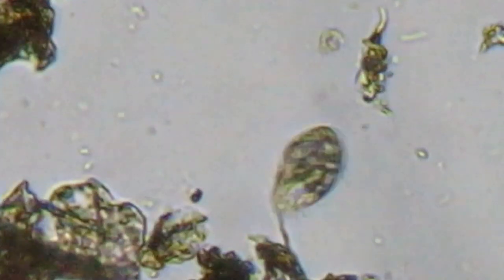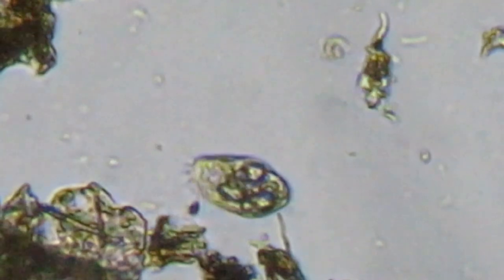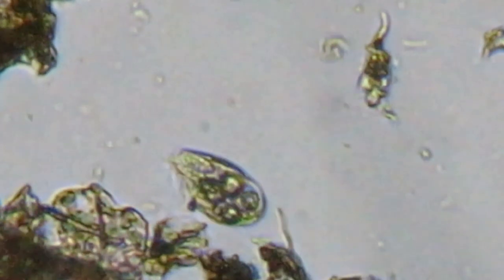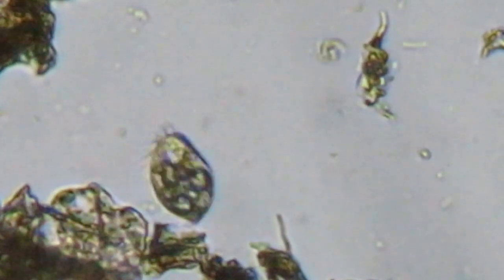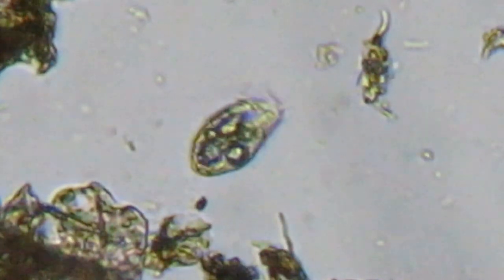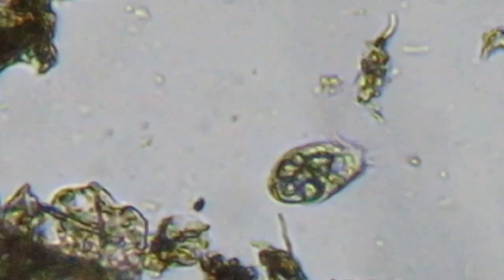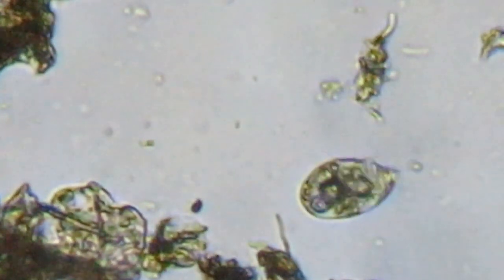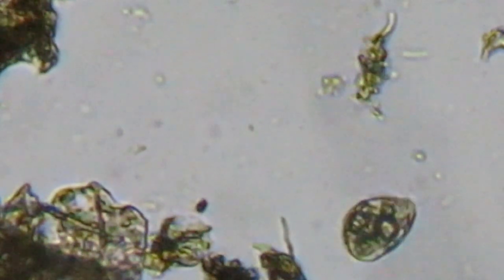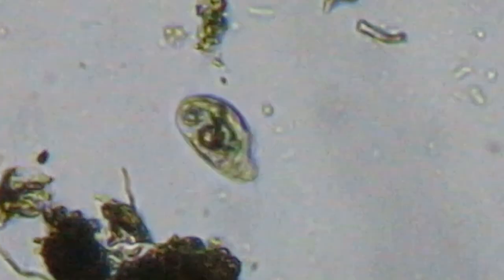You can see those little hair-like structures — that is the cilia beating. Those are mainly located to direct any microorganisms or organic debris in the water towards the organism, probably going towards the mouth. I think it actually ate that little organism. Those little refractile bodies are probably bacteria, which a lot of these little guys feed on — bacteria, algae, and other matter that may just be floating there. You can also see some vacuoles in there; those are the little clear refractive bodies within the protist itself.